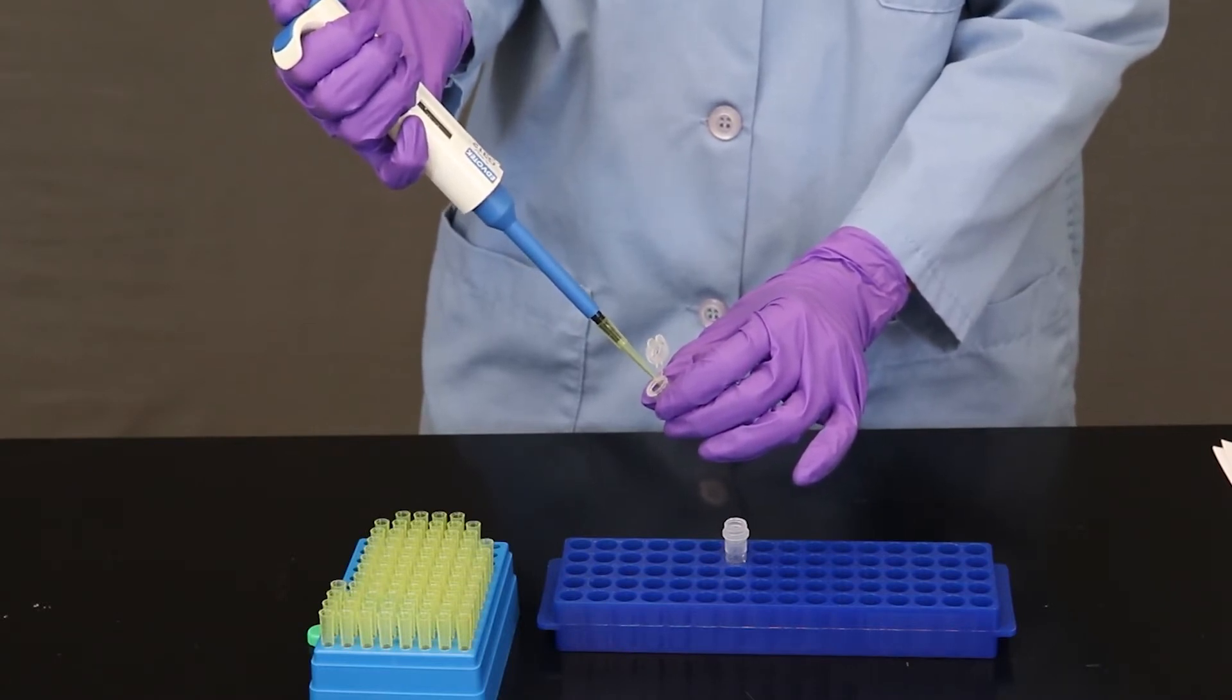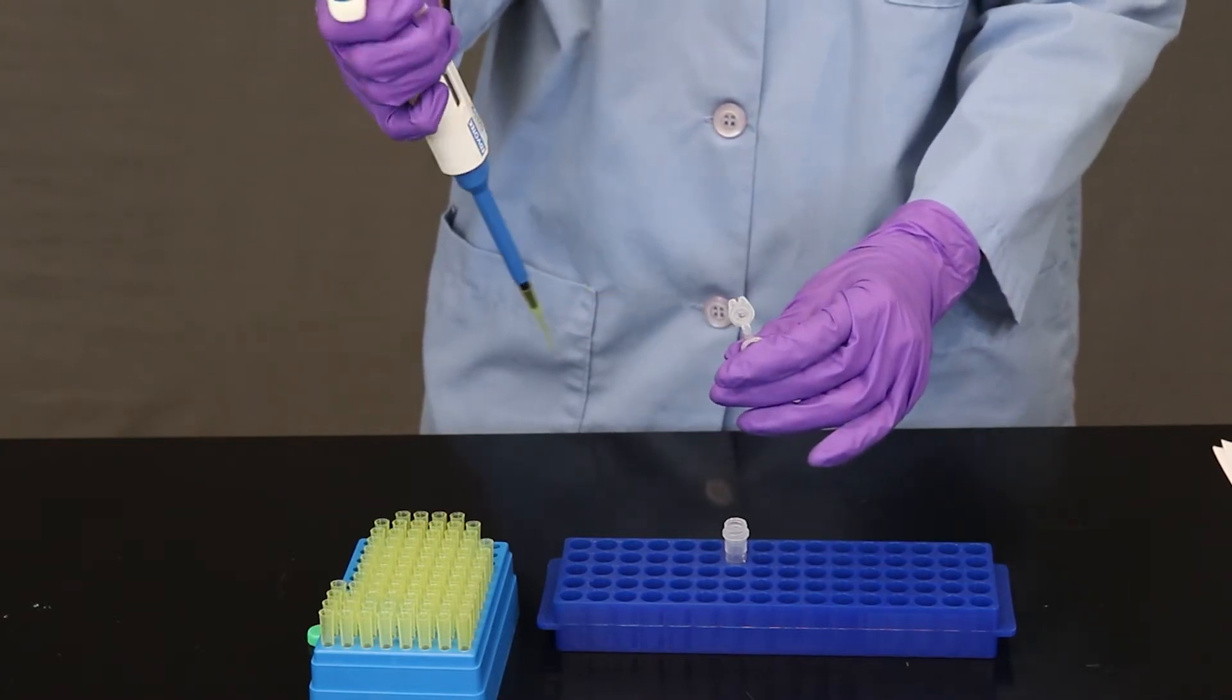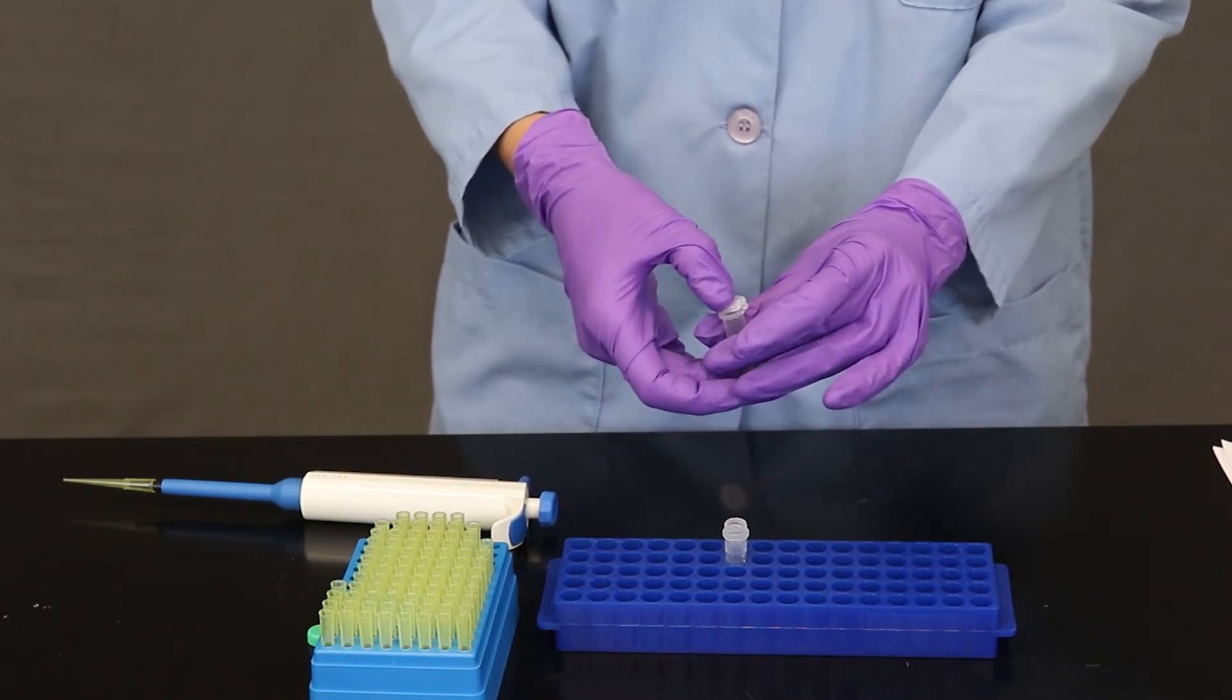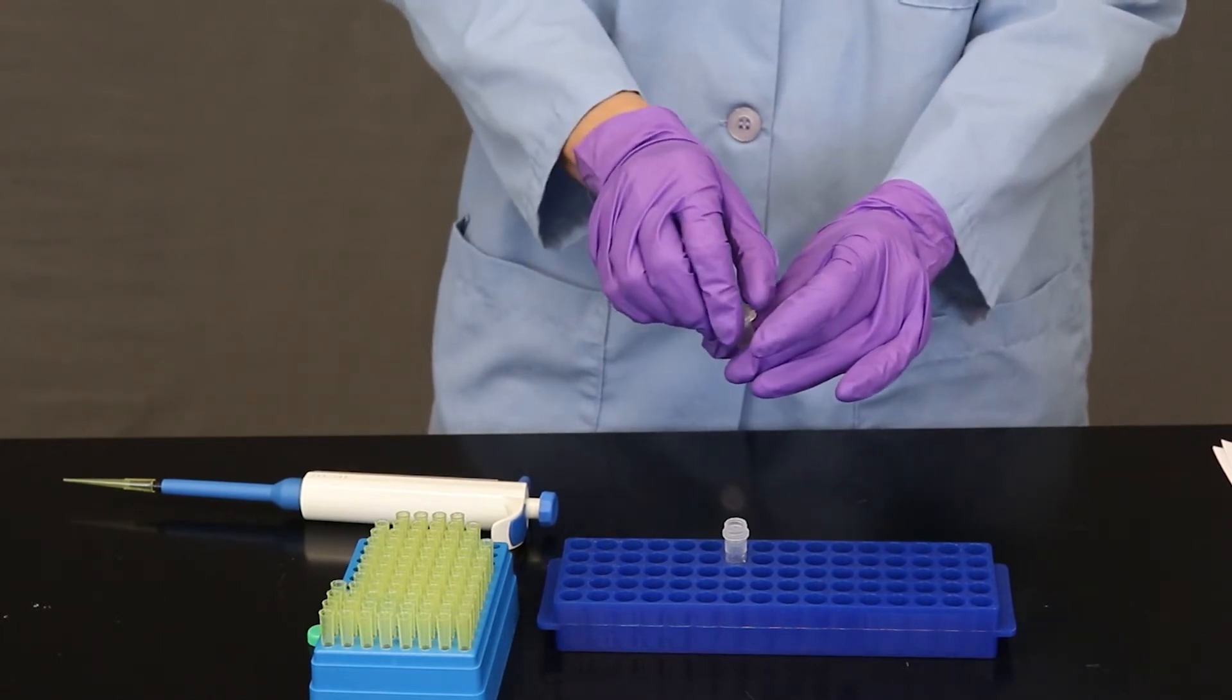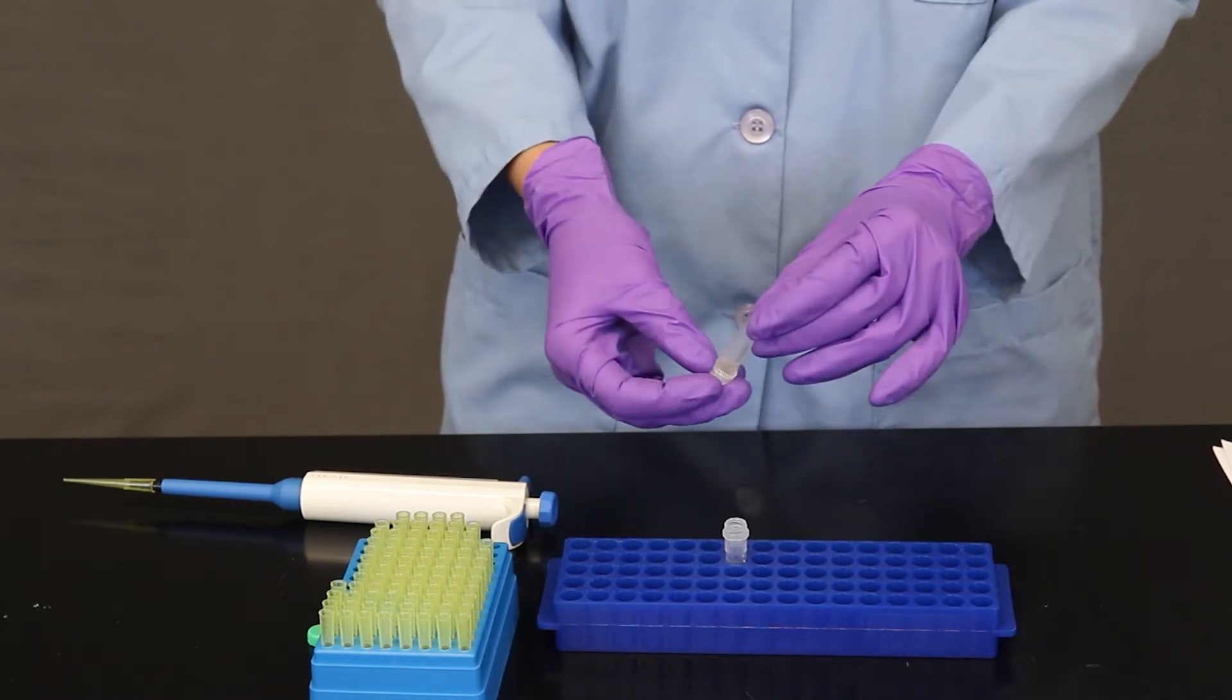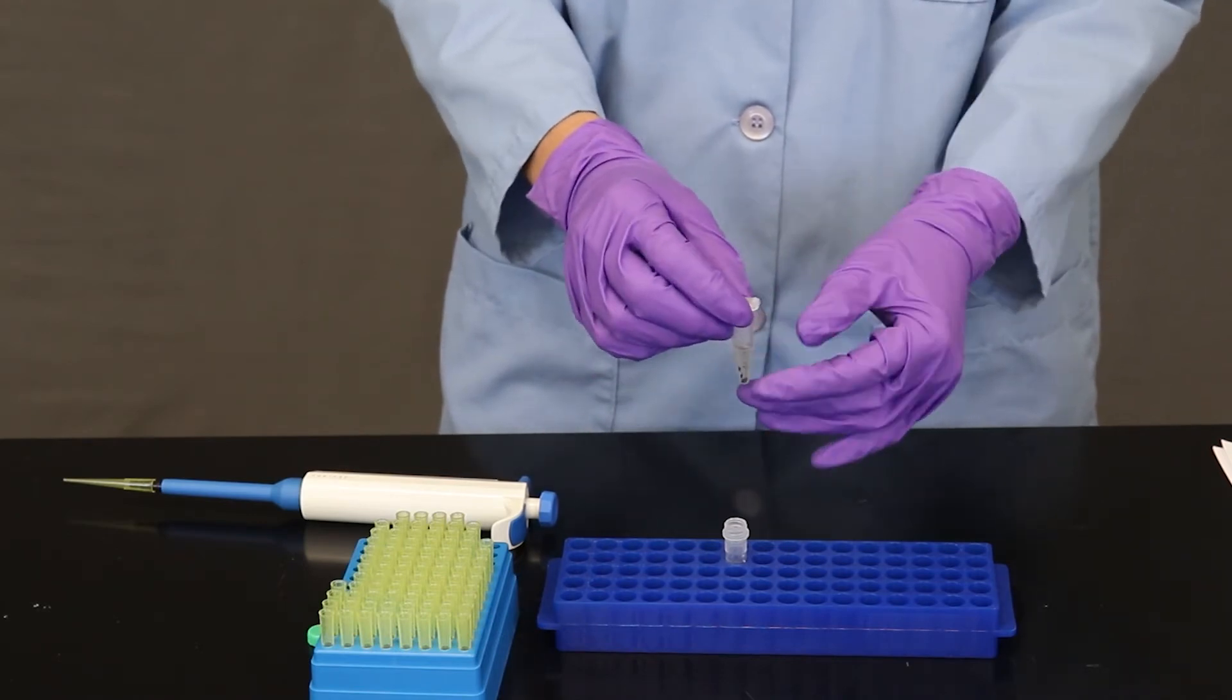And that will release the very last drop. So now I have my proteinase K and my lysis solution. I'm going to close the tube, mix it gently. And now I'm ready to put it into the hot water bath.